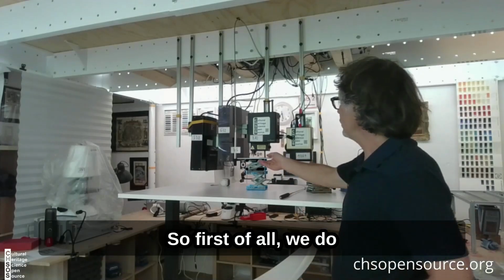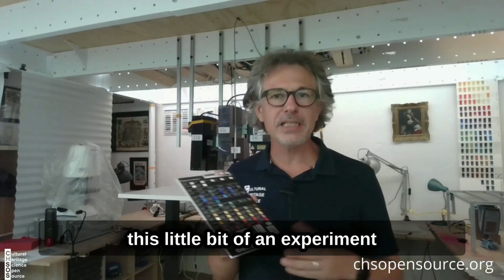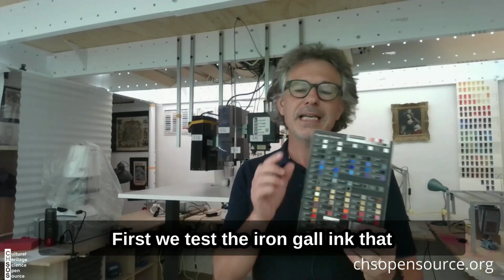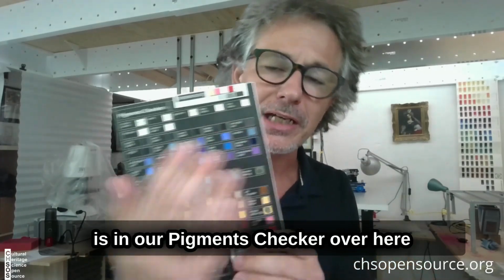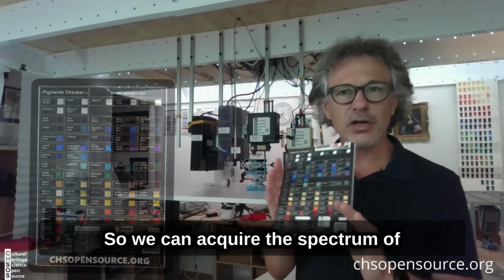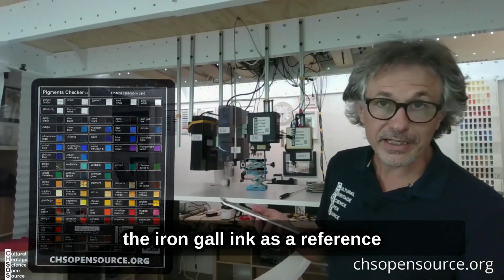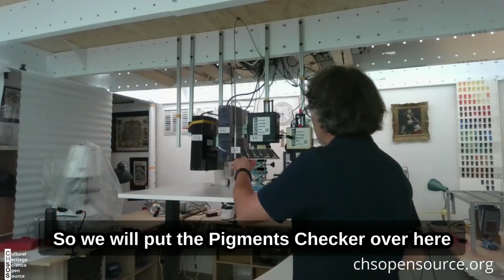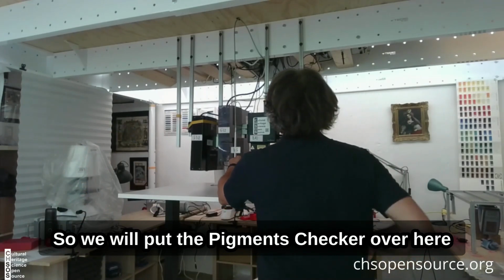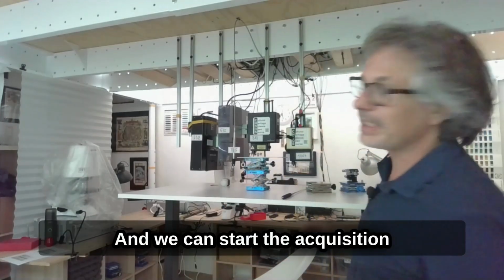So first of all, we do a little experiment. First, we test the iron Gall ink that is in our pigment checker over here. We can acquire the spectrum of the iron Gall ink as a reference, and then we compare the other ones. So we will put the pigment checker over here. Okay, and we can start the acquisition.